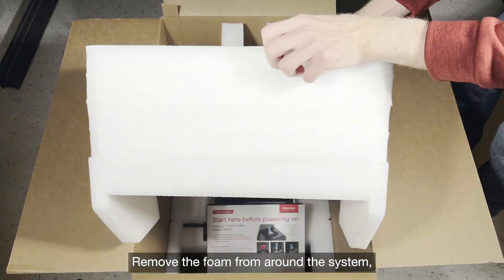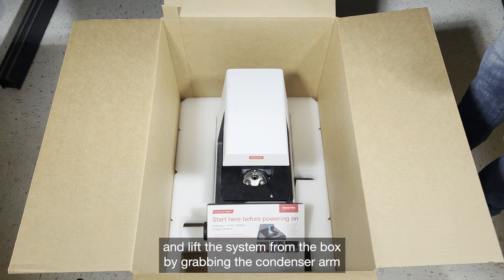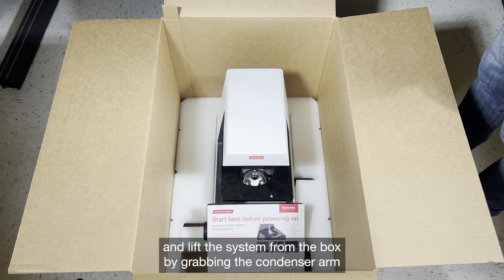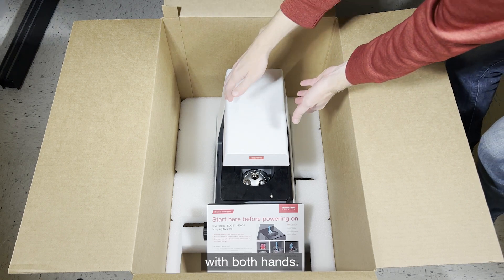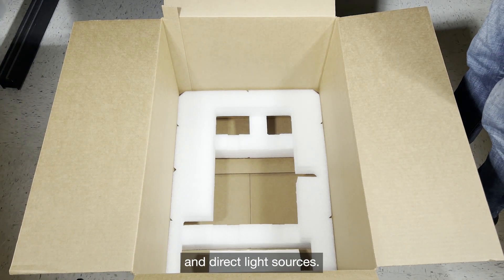Remove the foam from around the system and lift the system from the box by grabbing the condenser arm with both hands. Place the system on a stable surface away from vibrating equipment and direct light sources.